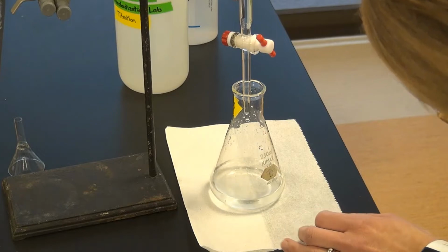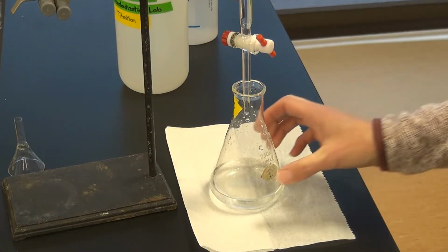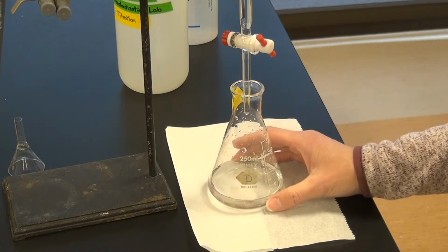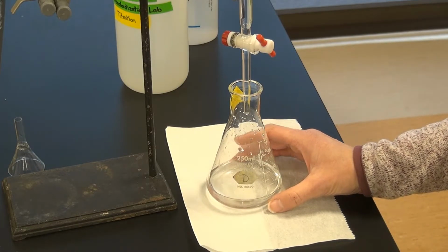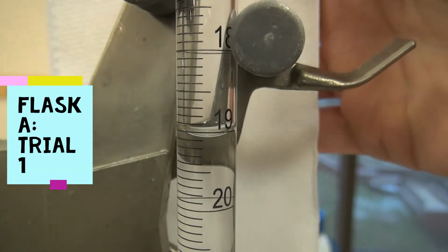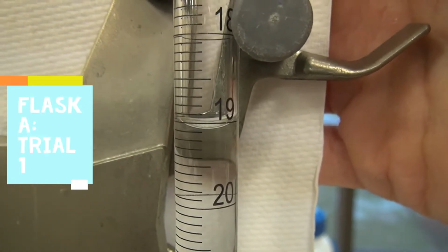Okay, now we're a little past 19, so I think now is probably a good time. I'm not going to go all the way, just a little bit closer to where I think the end point is, because I don't know how accurate my sodium hydroxide solution was prepared. So I'm going to take it easy so I don't overshoot it and I don't have to do a 4th run. We can get by with just doing 3 runs. Okay, now we're going to start reading it drop by drop so we can try to catch the endpoint.